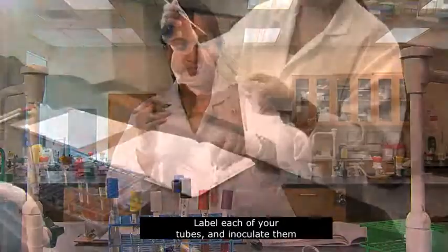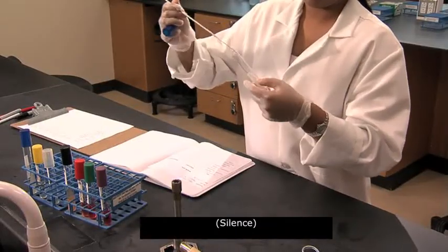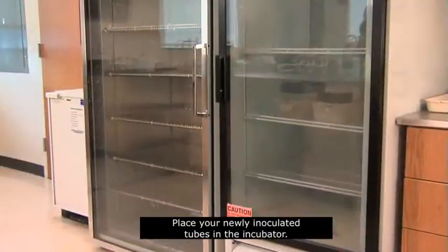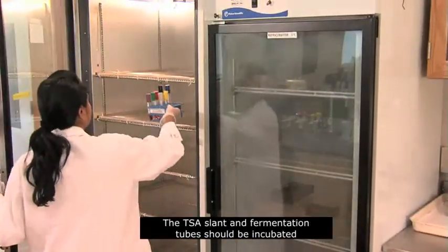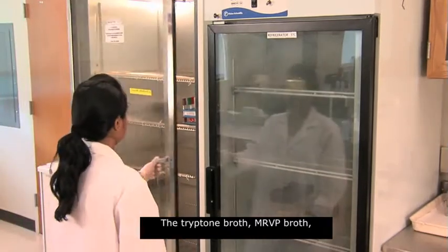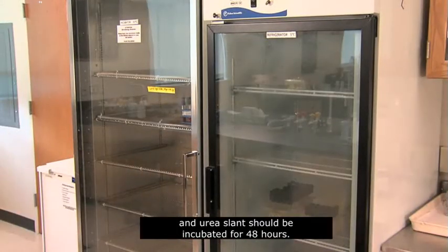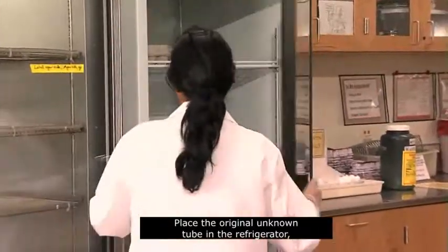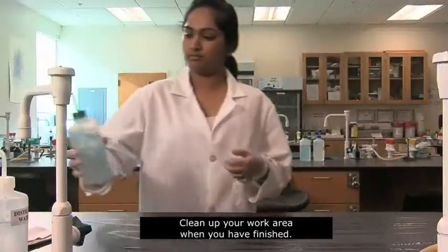Label each of your tubes and inoculate them from the unknown culture provided. Place your newly inoculated tubes in the incubator. The TSA slant and fermentation tubes should be incubated for 24 hours. The tryptone broth, MRVP broth, and urea slant should be incubated for 48 hours. Place the original unknown tube in the refrigerator, or as directed by your instructor. Clean up your work area when you've finished.